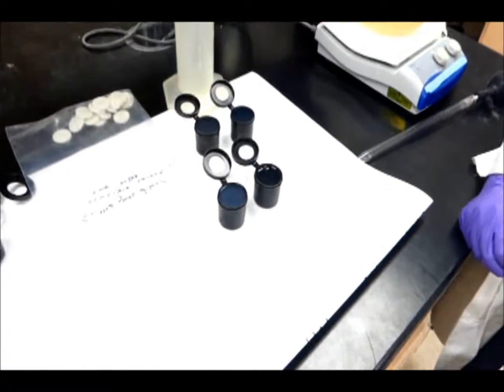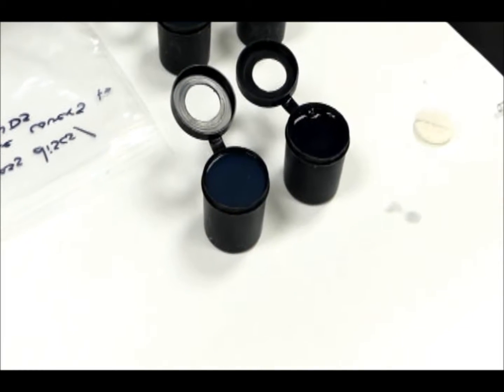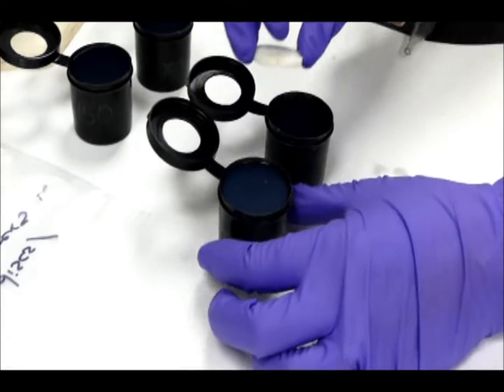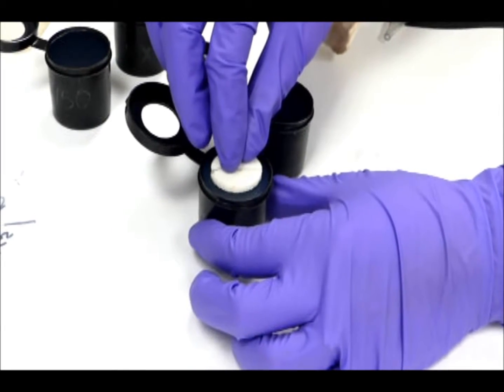So we've let our NDS cups cool a little bit to let the agar gel harden. There's going to be a little bit of a difference in color when it's hardened. It's going to be a little more milky looking. So you can see from these 2 that the one on the left is a little more milky colored and the one on the right is still pretty clear. So I'm going to take my glass disc, we're going to set it on top of my cup, and you can see that it's pretty hard.